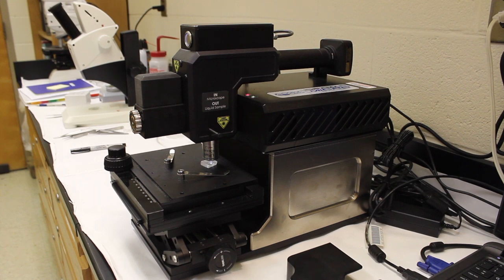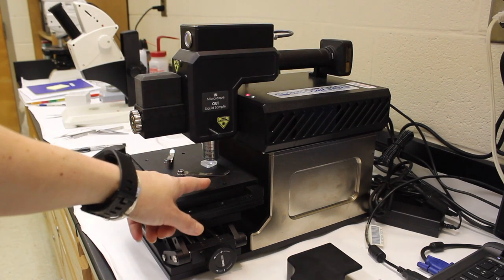Here is what focusing looks like on the instrument. The sample is under here.